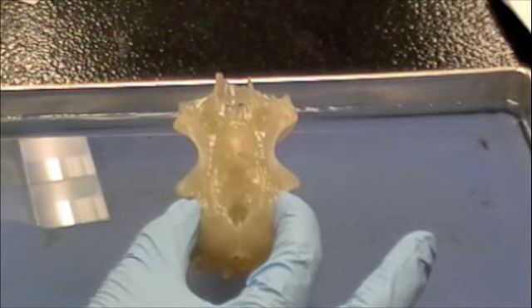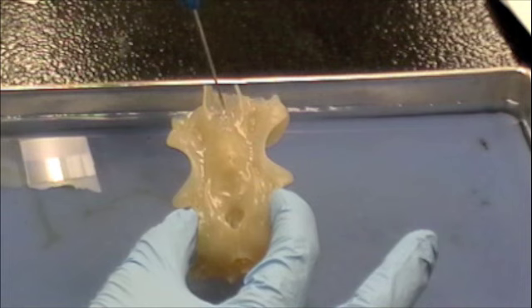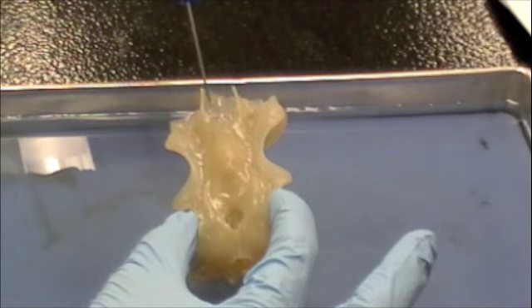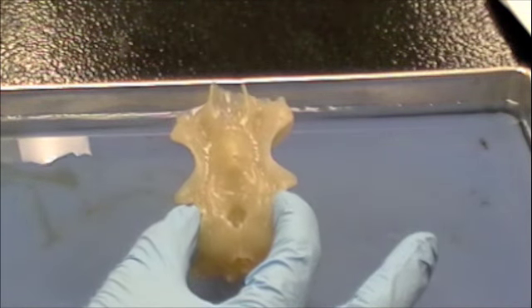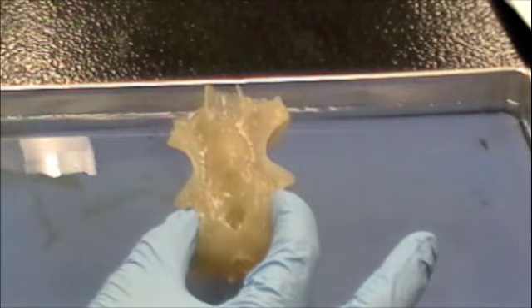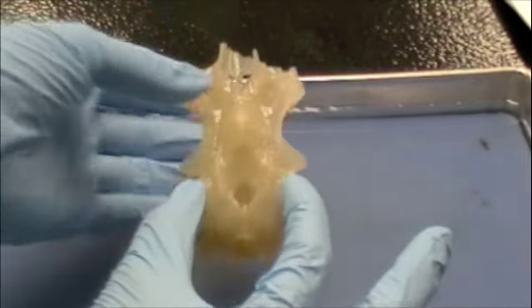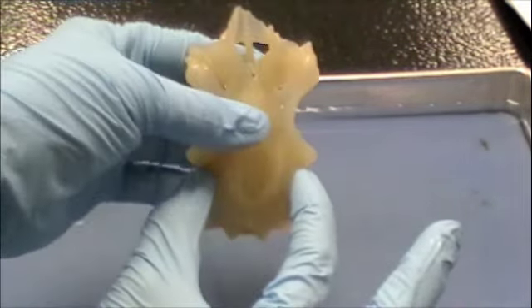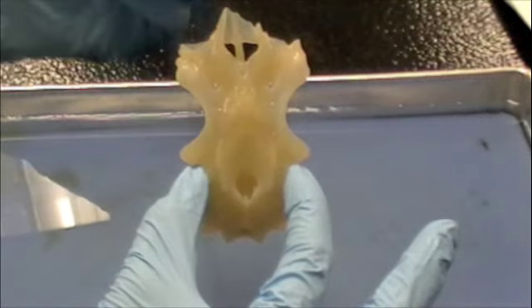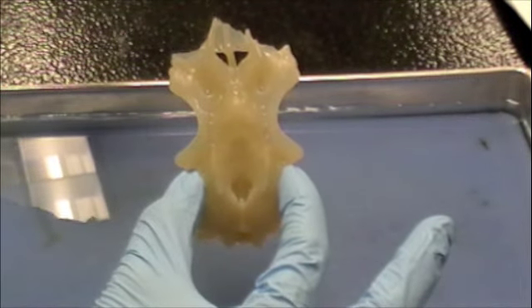The pre-cerebral cavity — this whole area right here. The rostral fenestrae are these little holes. Right there you can see the holes — rostral fenestrae.